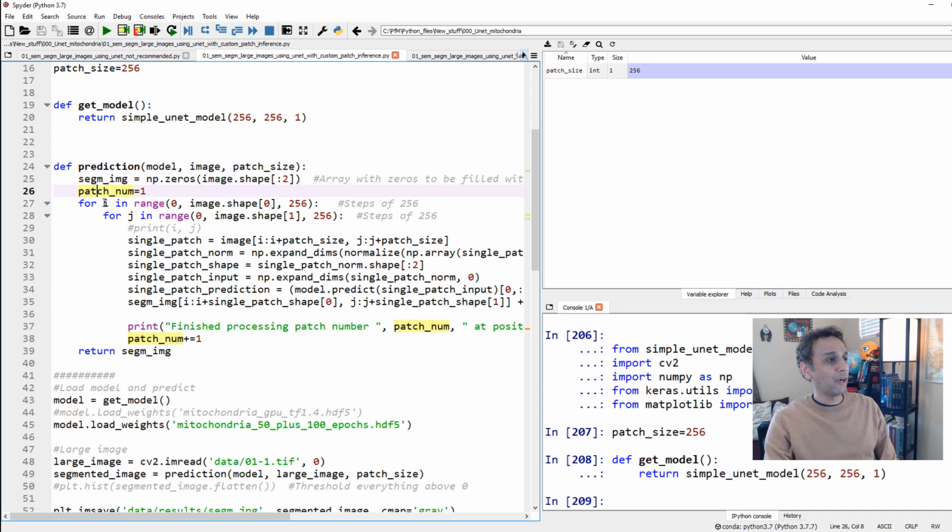Now for i in range 0 to image shape 0, which means let's say my image is 768 by 1024, right? So from 0 to 768 in steps of 256, do something. And 0 to 1024 in steps of 256, do something. What is that do something? Okay. First of all, extract a single patch. My single patch is basically 0 to 0 plus patch size, right? What is my patch size? 256. So go from 0 to 256, 0 to 256.